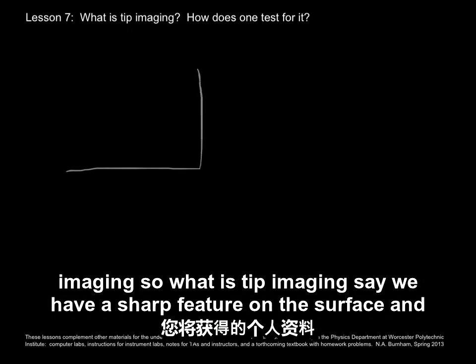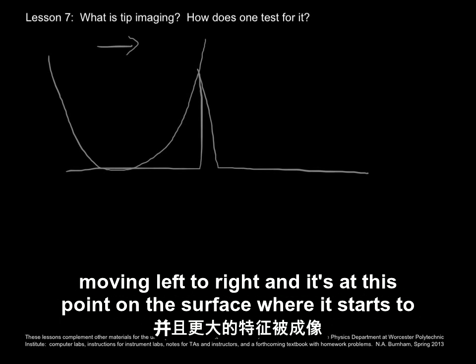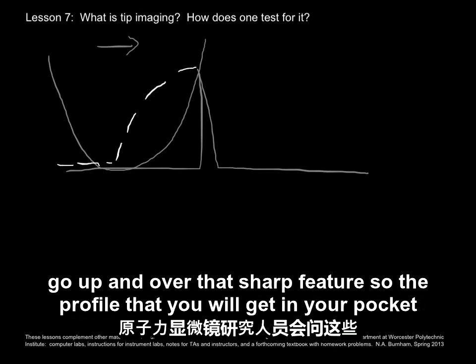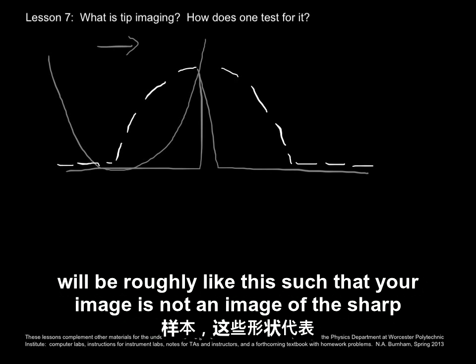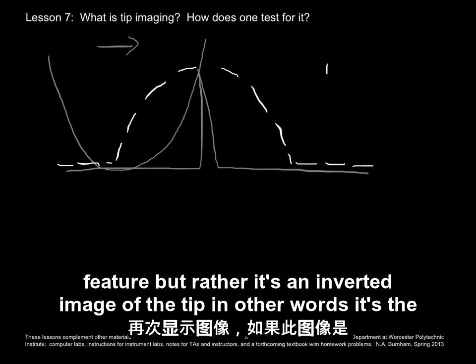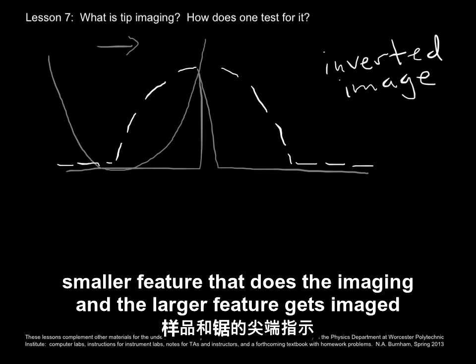Say we have a sharp feature on the surface, and our tip comes along like this, and it's moving left to right. And it's at this point on the surface where it starts to go up and over that sharp feature. So the profile that you will get in your topography image will be roughly like this, such that your image is not an image of the sharp feature, but rather it's an inverted image of the tip. In other words, it's the smaller feature that does the imaging, and the larger feature gets imaged.